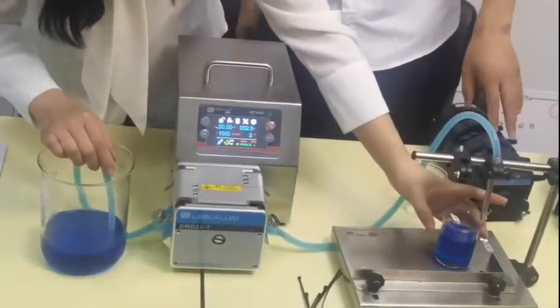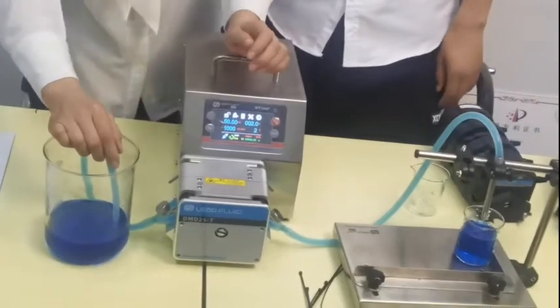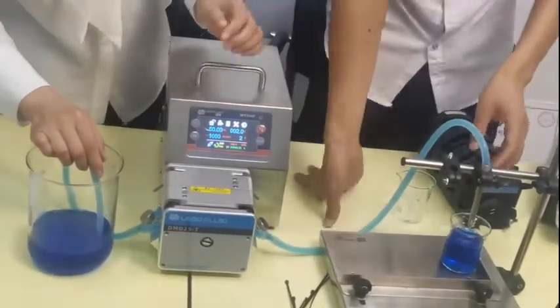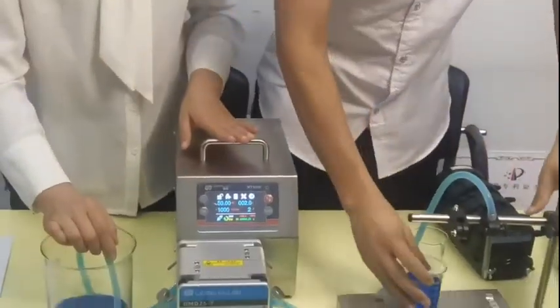What's the volume? Maybe it's 80. I can calibrate it now — it has the calibration function. Let me teach the customer how to calibrate. When you get a different volume, maybe the pump can calibrate.